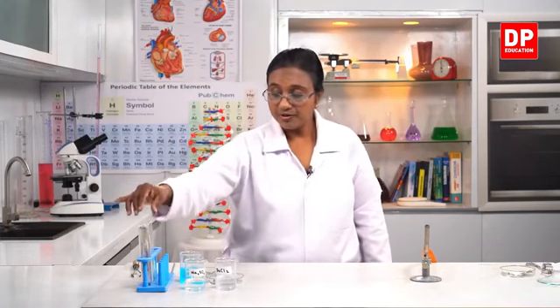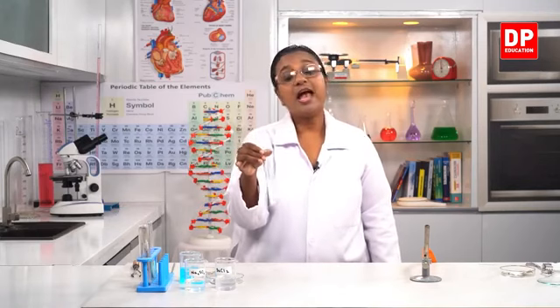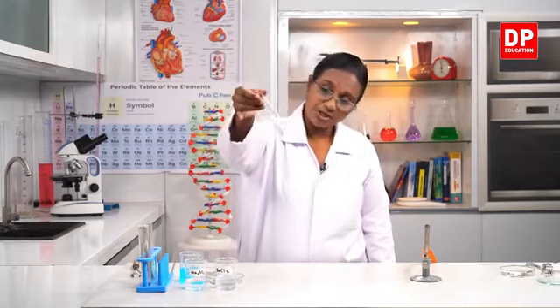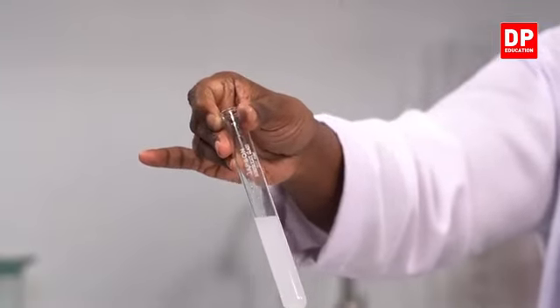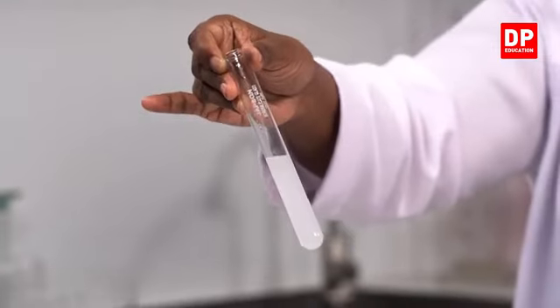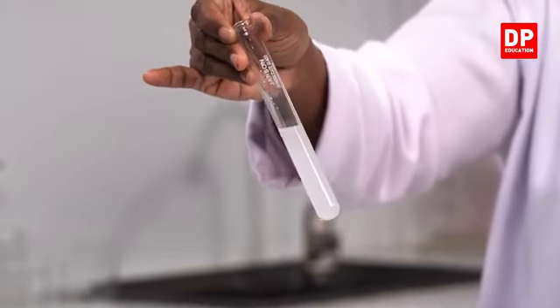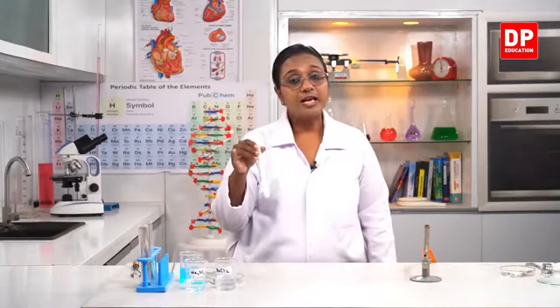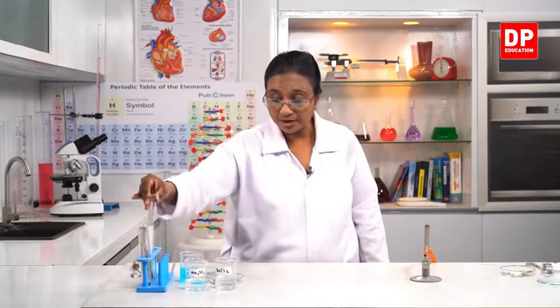And after that, what did we do? We did the reaction between barium chloride and sodium sulfate. And I told you all the product, barium sulfate, is a white colored powder. Normally, students, when we use a very large amount and leave it for some time, you will be able to see the white solid depositing at the bottom. But at least you were able to see the color change. It became milky in color because there was the production of barium sulfate. So barium chloride and sodium sulfate form barium sulfate and sodium chloride.